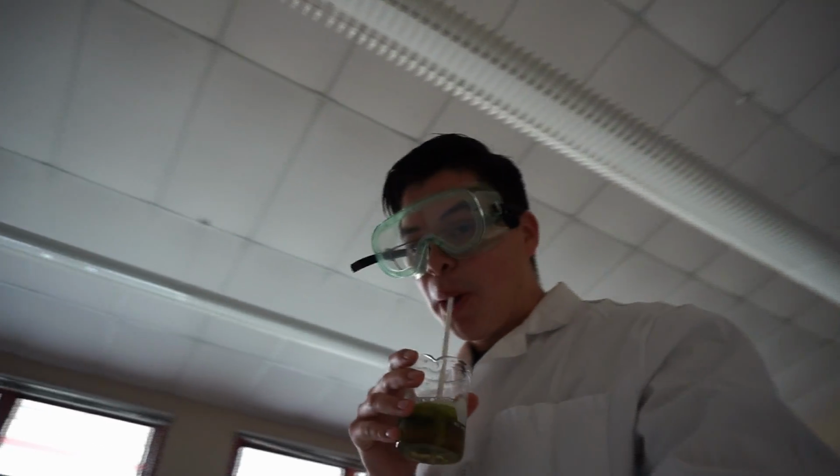I'm going to breathe a little bit more, but this should be just about enough to help us get started. Now all we need is our plant.